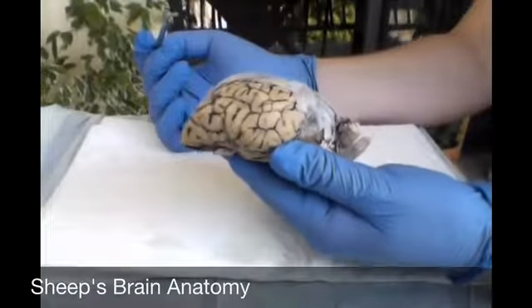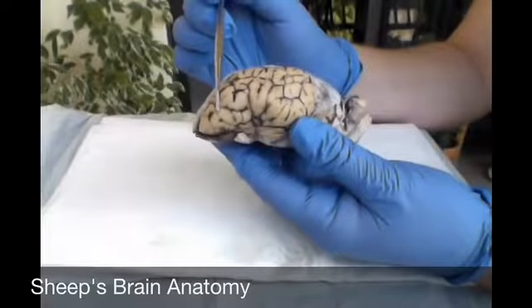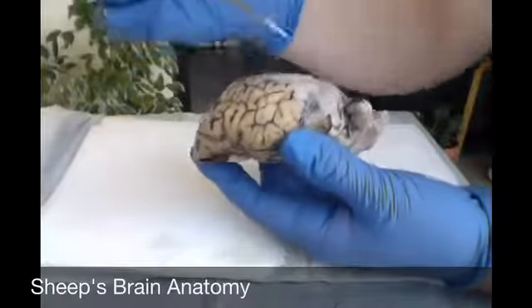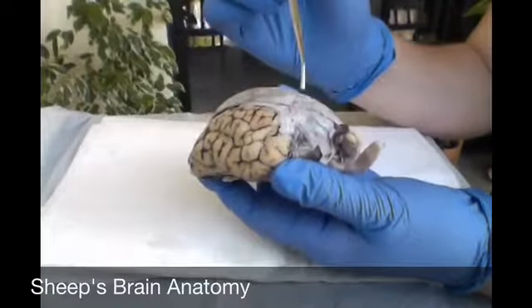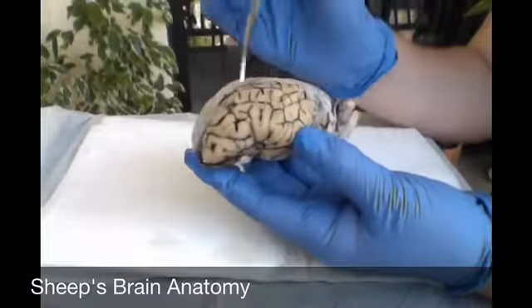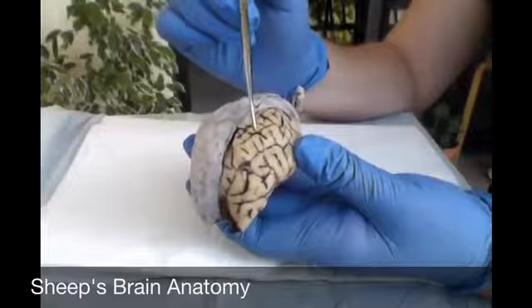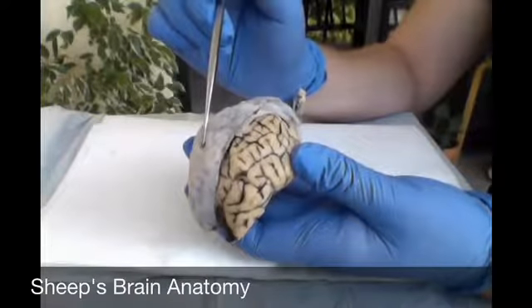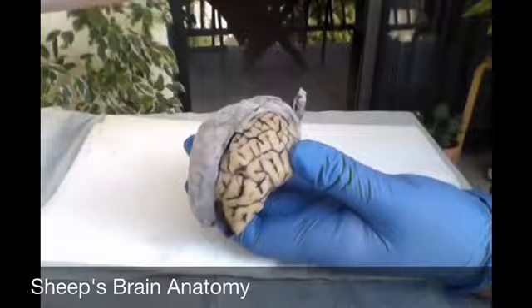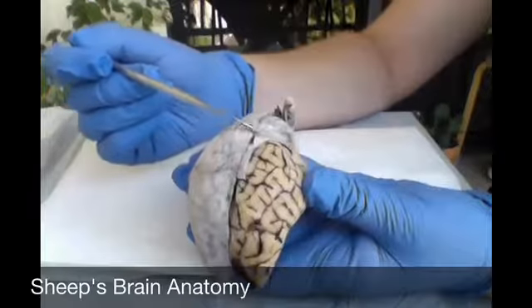So the first things we're going to look at are actually just the lobes. So here we have the frontal lobe, the parietal lobe, the temporal lobe, and the occipital lobe. And then looking at the back here, you can see the cerebellum. So here we have the cerebrum, and looking at it from my angle, I see the left and right hemispheres. And going down the middle is called the longitudinal fissure.